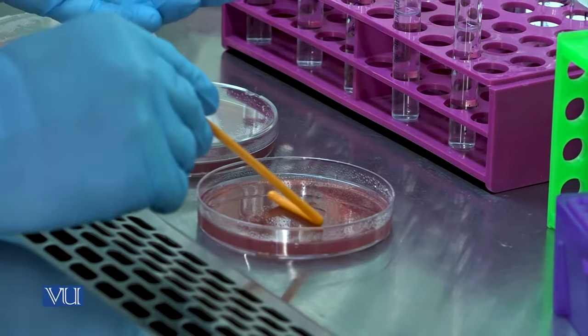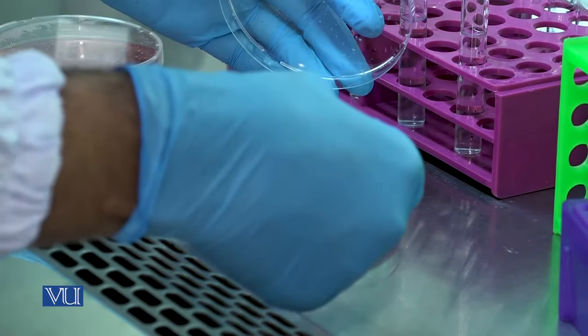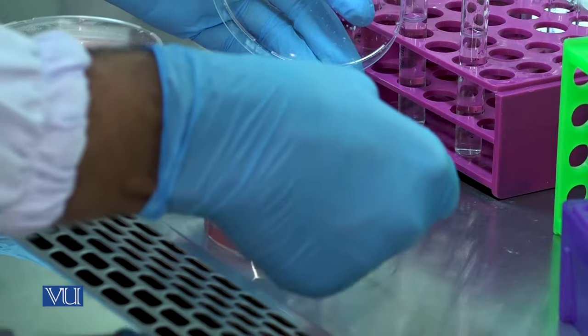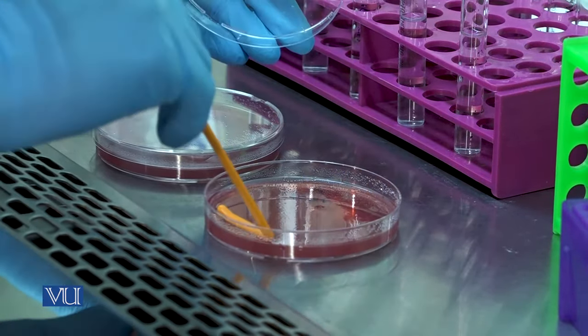Pick the disposable bacterial spreader and use it to gently spread the first dilution in the culture media plate. Move the spreader throughout the plate to uniformly spread the solution inside the plate.